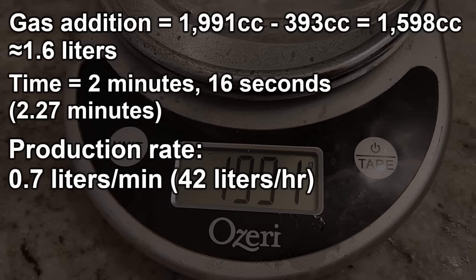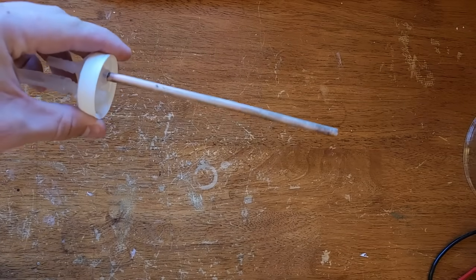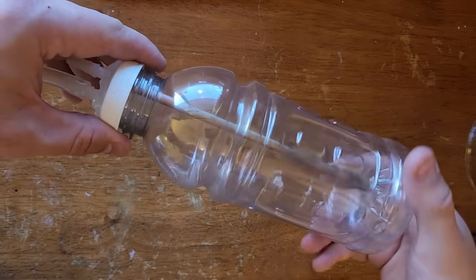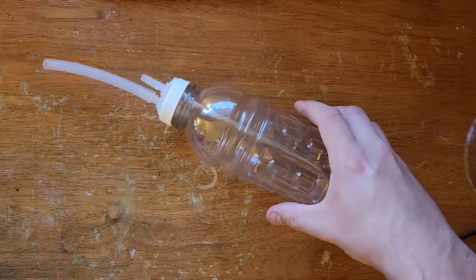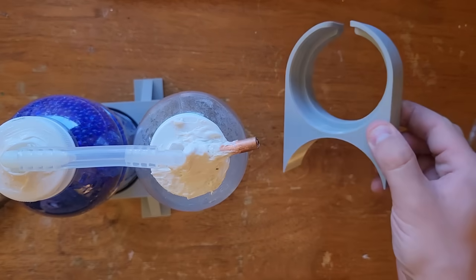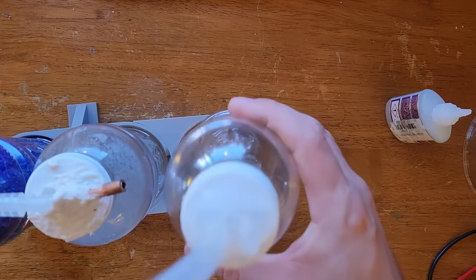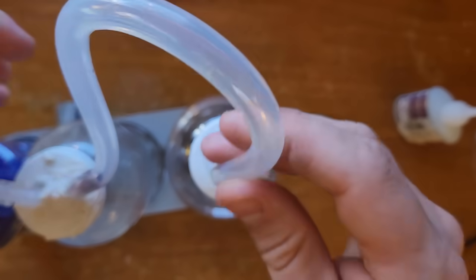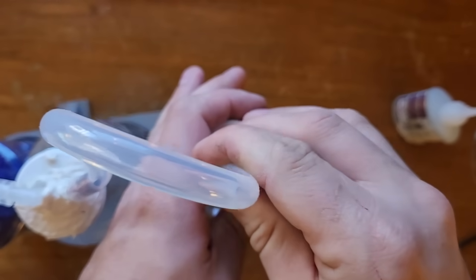Not bad considering I probably need only 20 or 30 liters to fill the second stage of my cascade system. Out of curiosity, I added a third bottle specifically for collecting the liquid output of the generator. Ideally this should be 100% water, but in reality I think there's some ether and unreacted ethanol because the bubbler water always ends up smelling like an open can of paint or some sort of intense solvent. Collecting the liquid here should allow me to analyze it later.